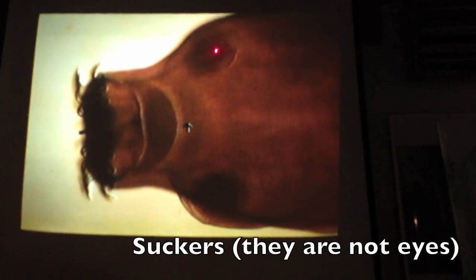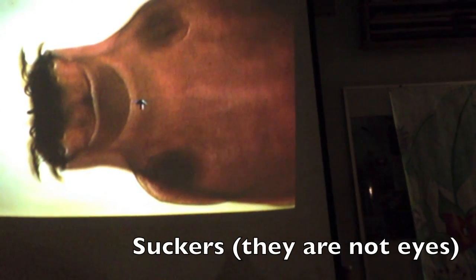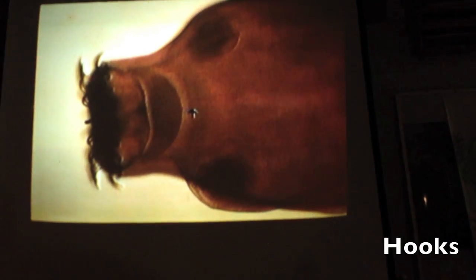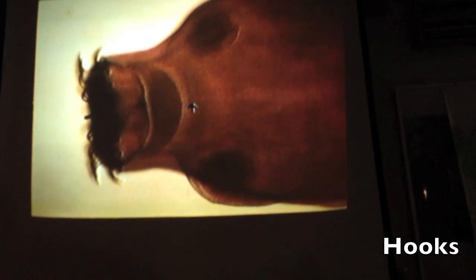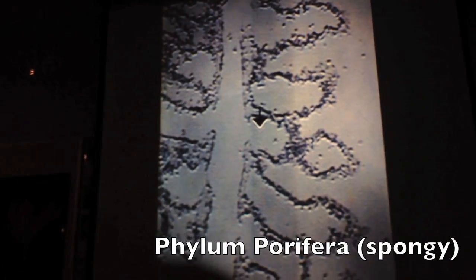And you've got, are these eyes? They're suckers. Suckers and hooks. Remember, the scolex is not a head, it's just an attachment device. Around here in the snout, see those are hooks. So what phylum are we looking at here?